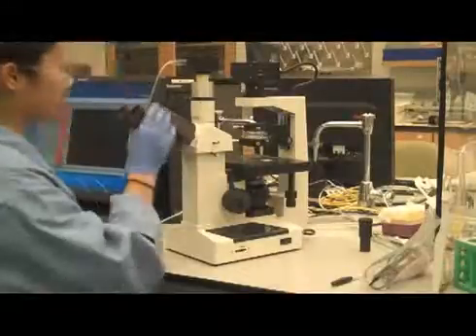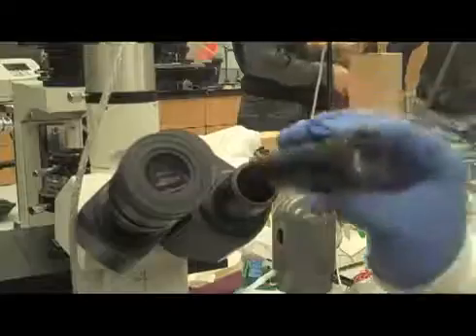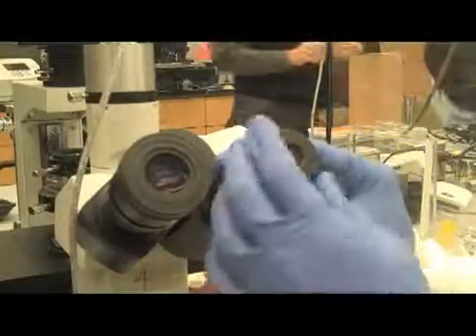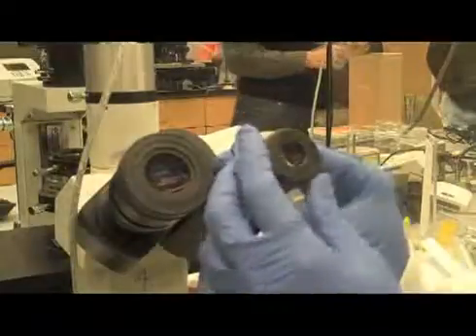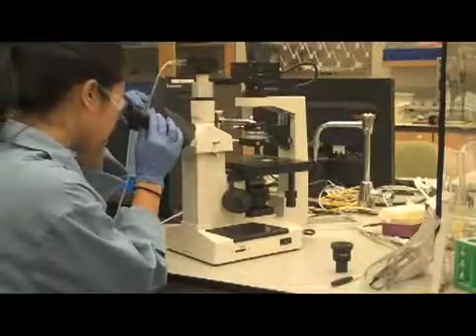Step 11: Take out one eyepiece and insert the center telescope into the eyepiece tube. Step 12: While looking through the center telescope, you will see a ring of light. To bring the image of the ring into focus, hold the base of the center telescope and turn just its lens piece.